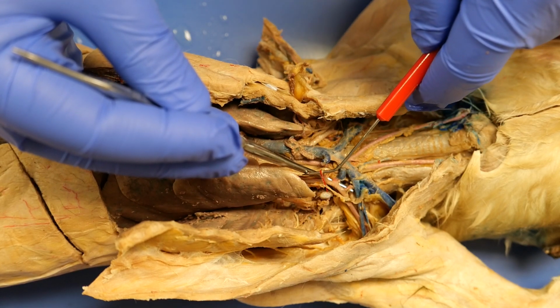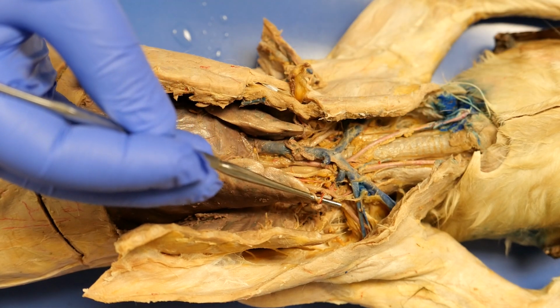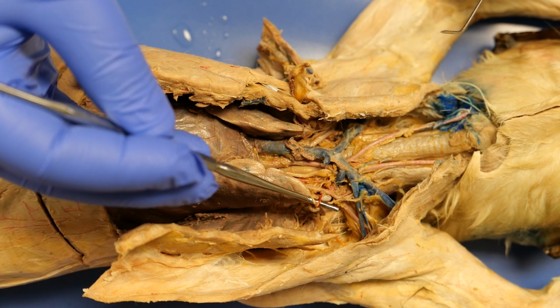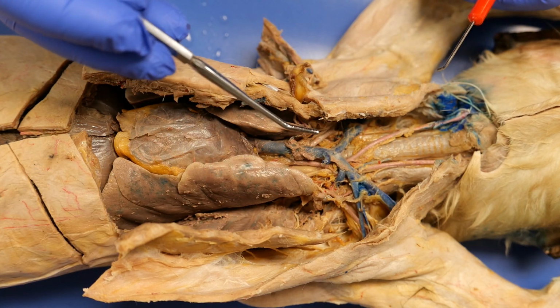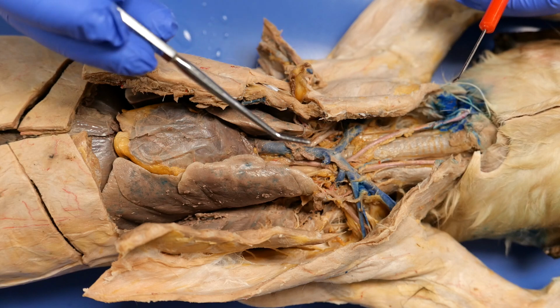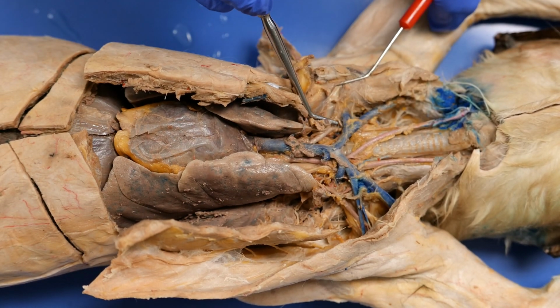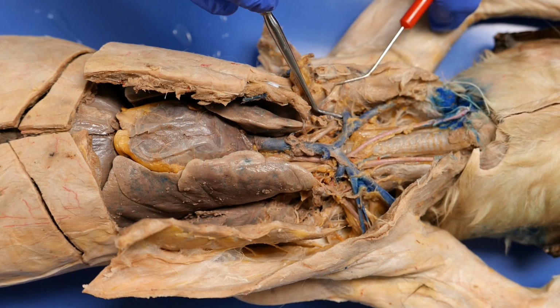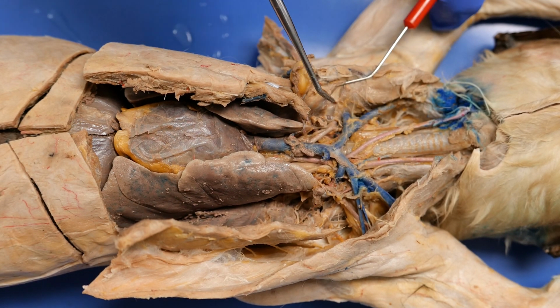The one going forward that's cut here, this one right there, that's going to be the internal mammary. And if you keep going on the right subclavian, right after that landmark of the thyrocervical, you then have the axillary. After that, this becomes the axillary. You have a ventral thoracic going up, a long thoracic going down.